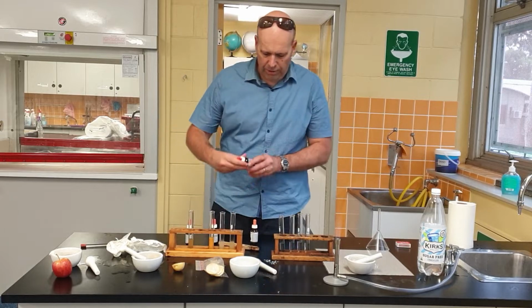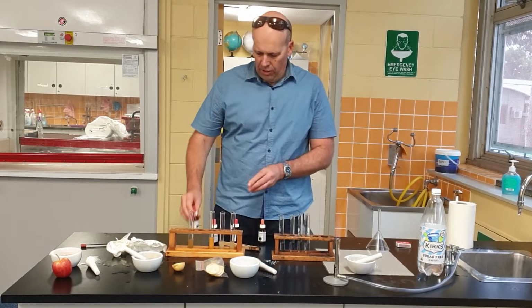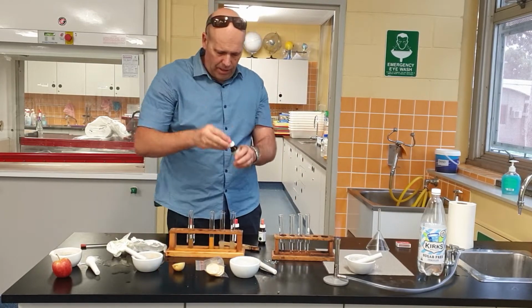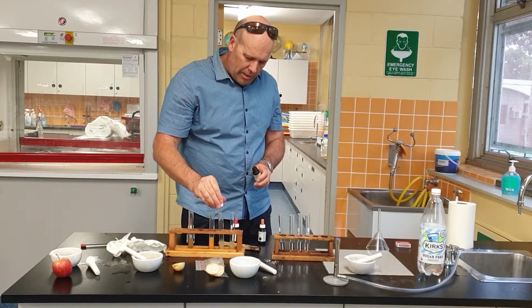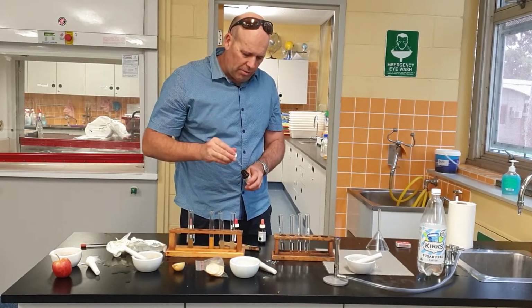All right, next one. What are we going to do now? We're going to do proteins. So what am I using for the proteins? I'm using biuret. Okay, so I'm going to use some biuret. This time I'll put some biuret in and give it a swirl.